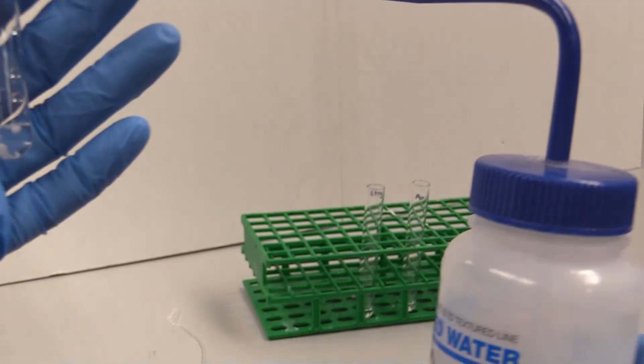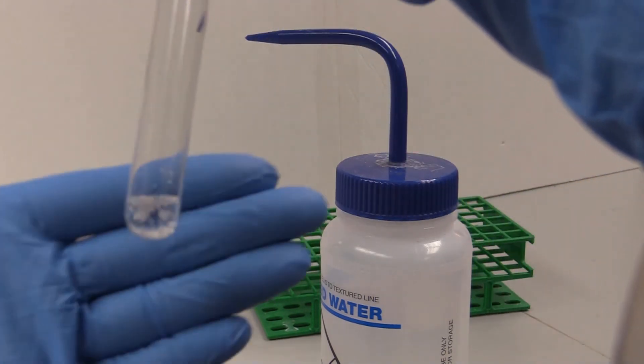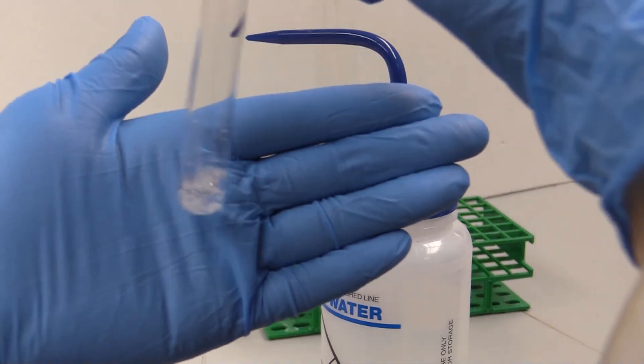If you add a solvent, in this case water, and it doesn't dissolve after a lot of agitation, this is a good solvent candidate and should go on to the next step.